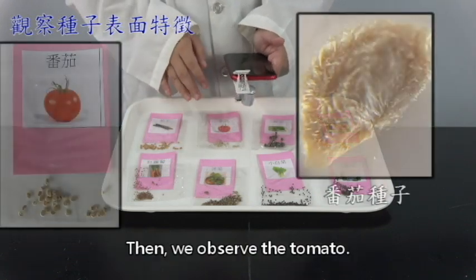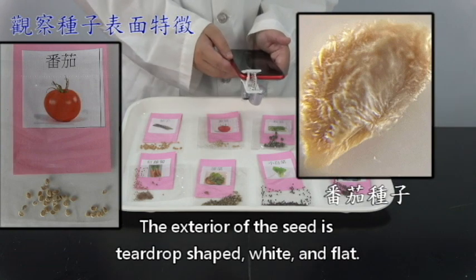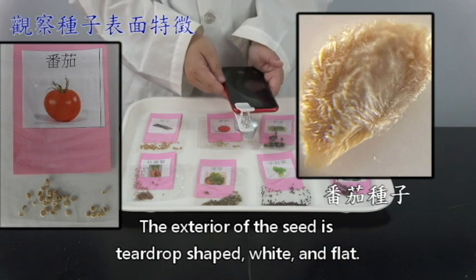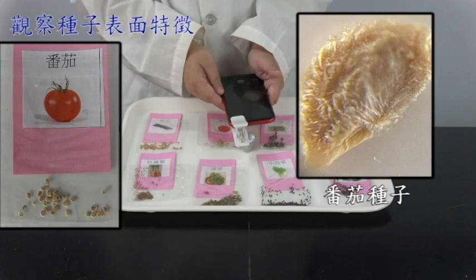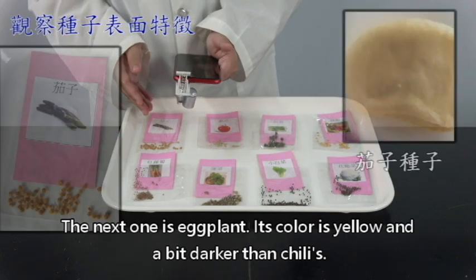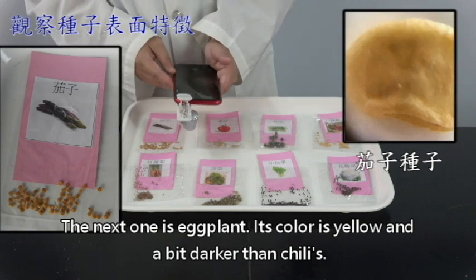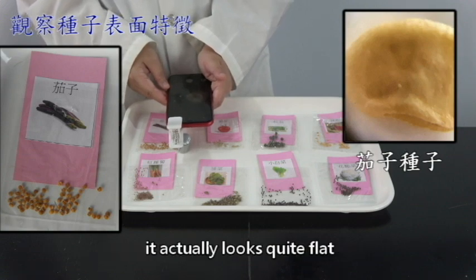Then we observe the tomato. We observe the tomato seed by naked eyes. The exterior of the seed is teardrop shaped, white and flat. Under the microscope, it is actually uneven. The next one is eggplant. Its color is yellow and a bit darker than chilies. Let us observe under the microscope. It actually looks quite flat.